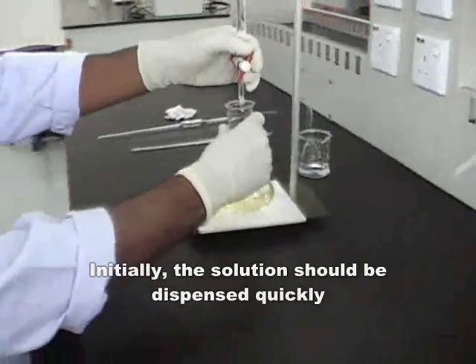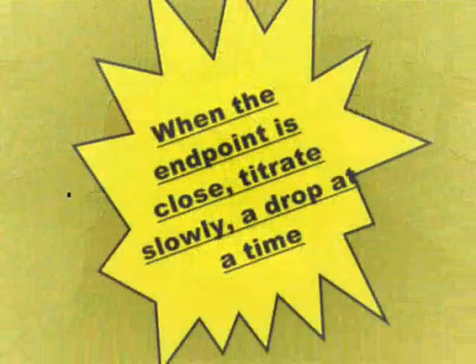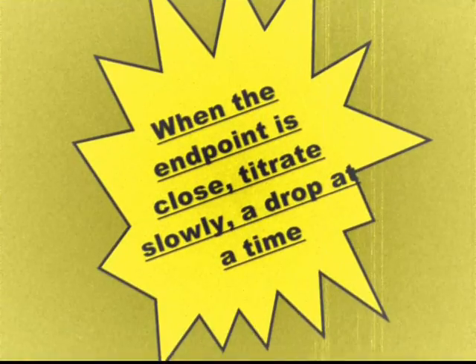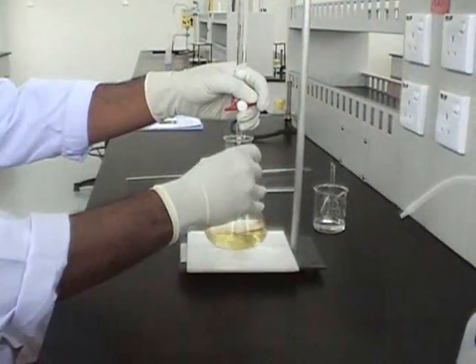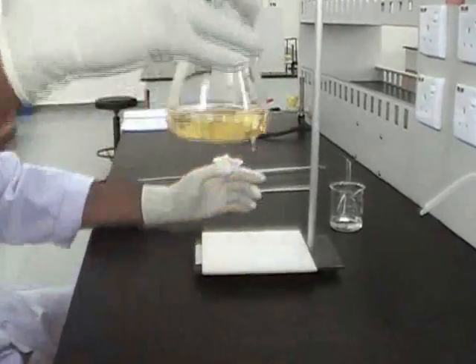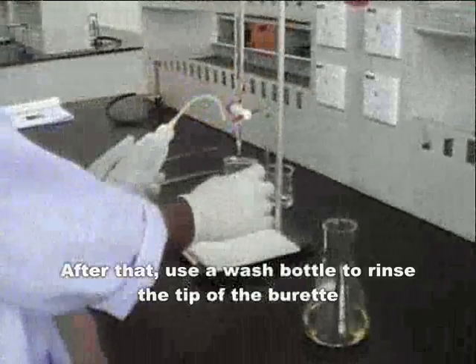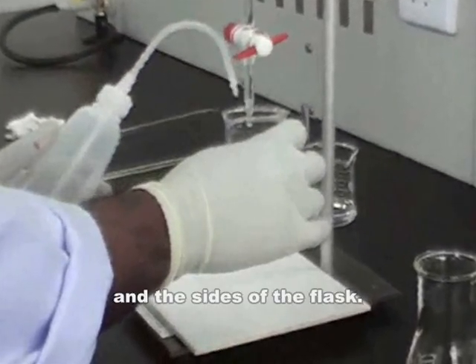Initially, the solution should be dispensed quickly until a few milliliters from the endpoint. When the endpoint is close, titrate slowly, a drop at a time. Record the level of the meniscus in the burette carefully after every titration. After that, use a wash bottle to rinse the tip of the burette and the sides of the flask.